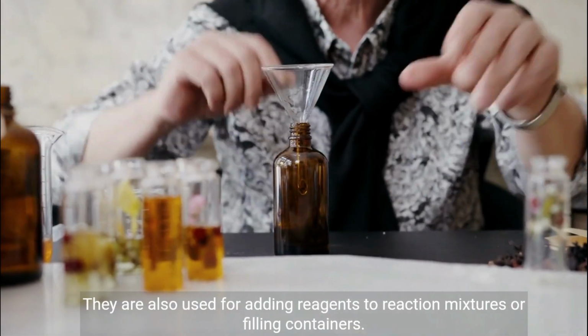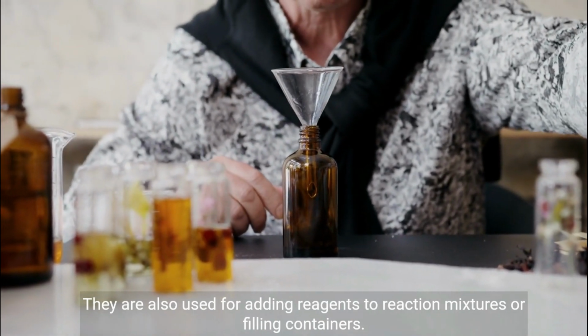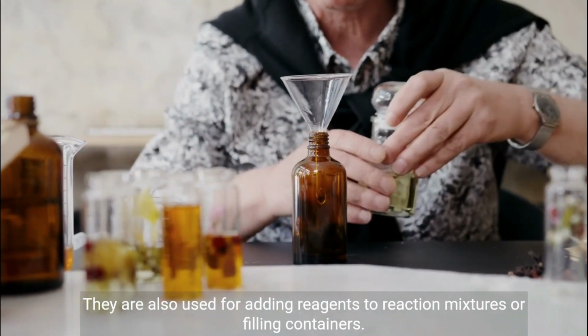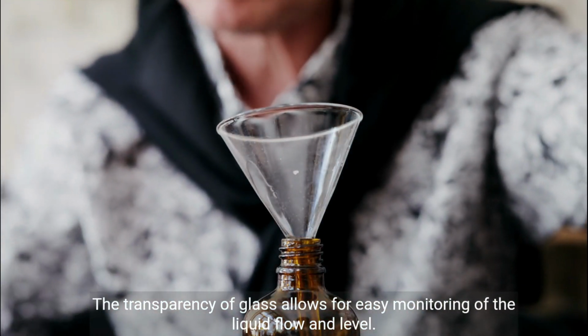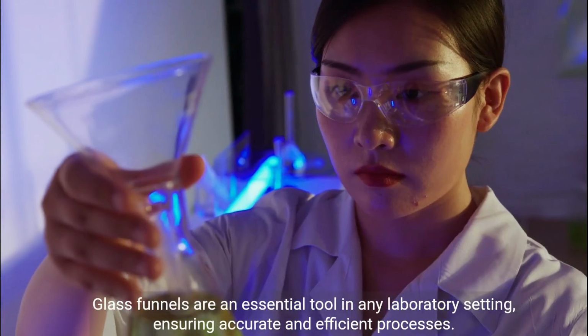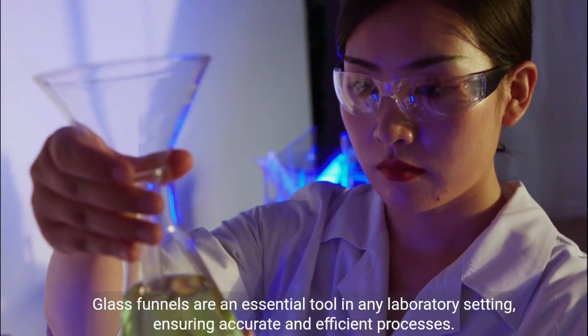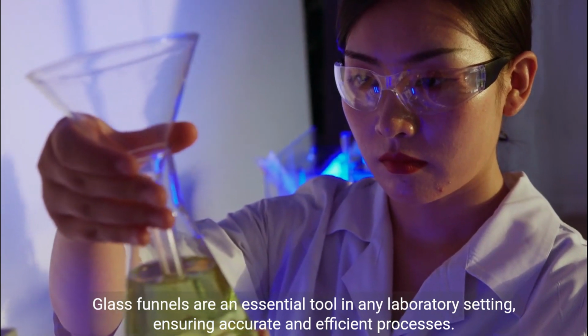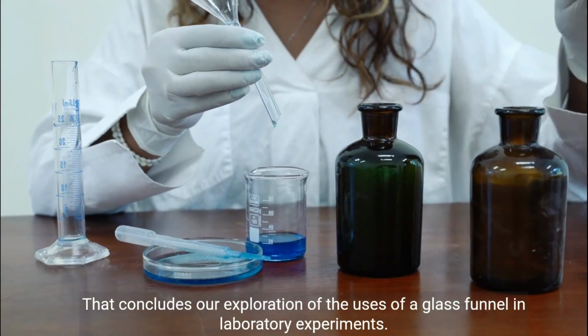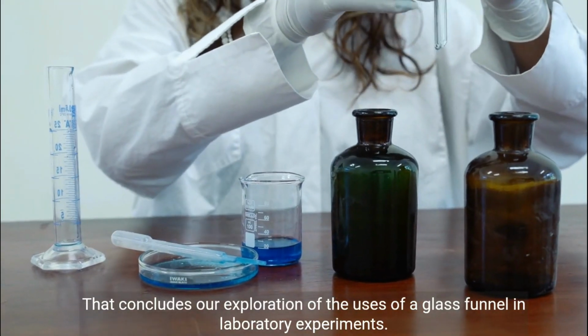They are also used for adding reagents to reaction mixtures or filling containers. The transparency of glass allows for easy monitoring of the liquid flow and level. Glass funnels are an essential tool in any laboratory setting, ensuring accurate and efficient processes. That concludes our exploration of the uses of a glass funnel in laboratory experiments.